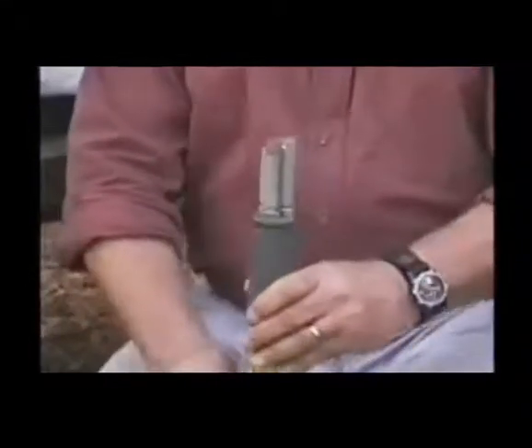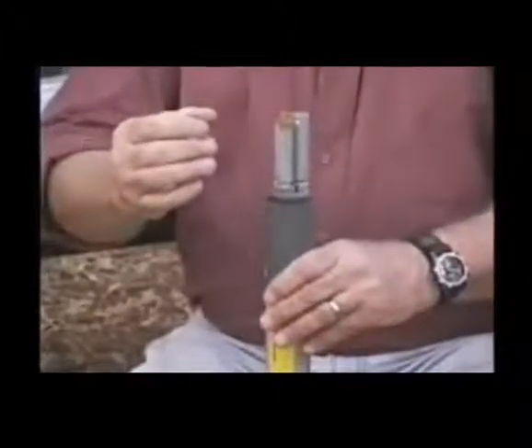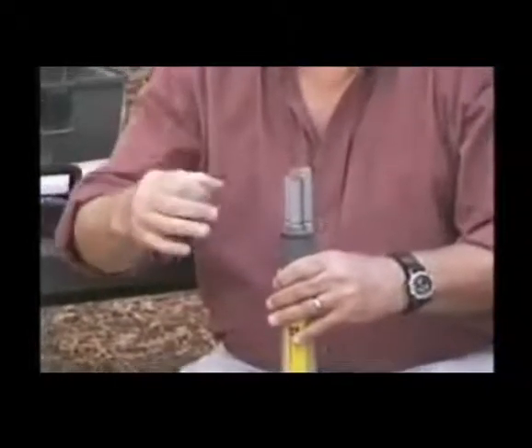Okay, now I will demonstrate how to install a dissolved oxygen membrane on a YSI 600XL dissolved oxygen probe. The probe from the manufacturer is clean and dry. You can see the probe here, the two shiny electrodes. What we need to do is put an electrolyte in the probe. The probe has a slight recessed area, and that area will be filled with electrolyte, and then the dissolved oxygen membrane will be installed on top of that and secured with an O-ring.